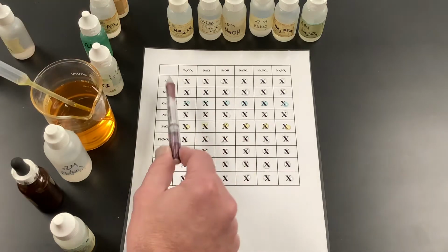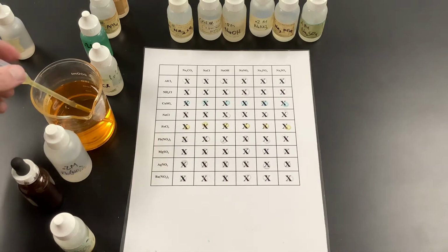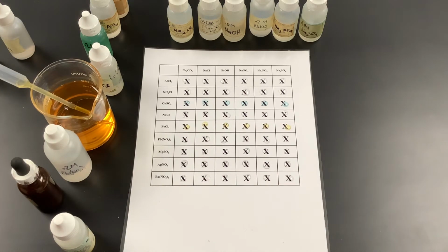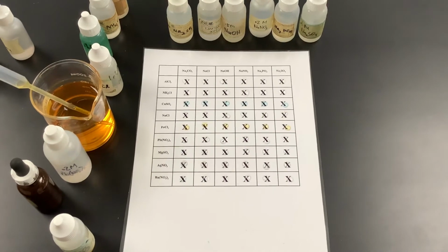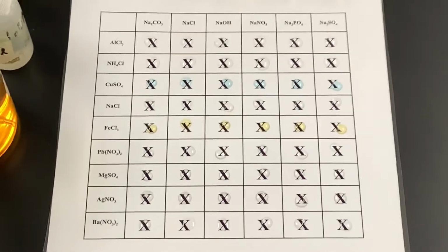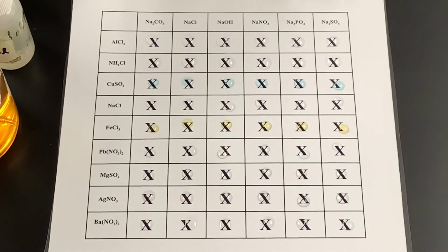What we're going to do is mix each one of these together. You'll see there's already some dots on the paper. I already took some of the sample and put a drop on top of the X. I've put aluminum chloride in each one of these boxes. I'm going to take each one of these chemicals and mix it with the aluminum chloride, and we'll see if any type of reaction occurs. That reaction shows us that a precipitate is forming. To help us see the precipitate, that's what the black X's are for. The black X's will get harder to see if a precipitate is going to form.